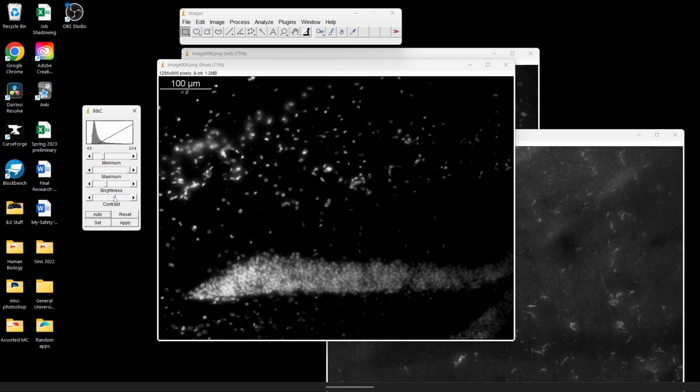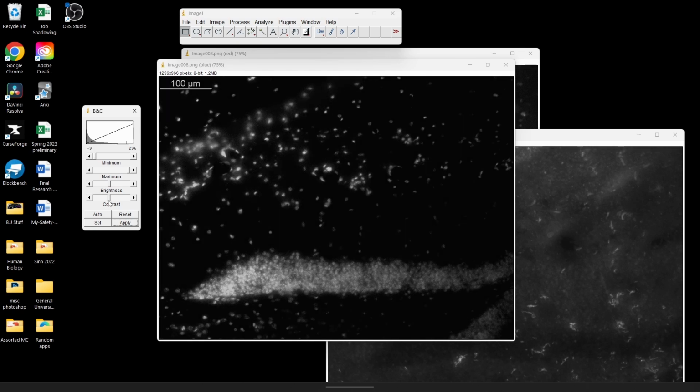One thing that I have to remember though is that DAPI is really, really bright, especially compared to some of the weaker antibody stains. And so I've got to make sure that I'm toning down the brightness a little bit more than I would with my other channels. All right, so that looks good to me. I'm just going to go down to apply. And then this little window is just telling me that it's going to overwrite the image information that it started with. So we're going to make sure that we already had it saved in just completely raw somewhere else, just in case we need to start over, because this is going to actually permanently edit the pixel values.